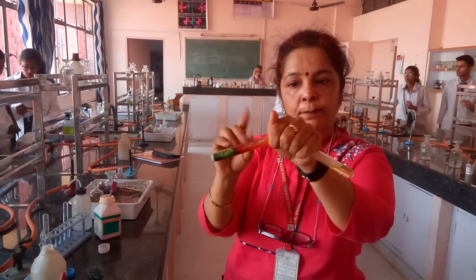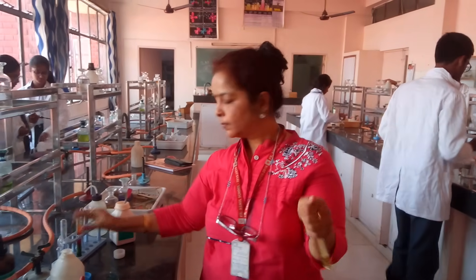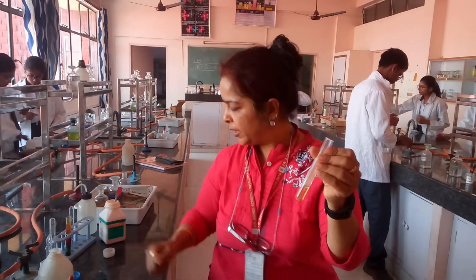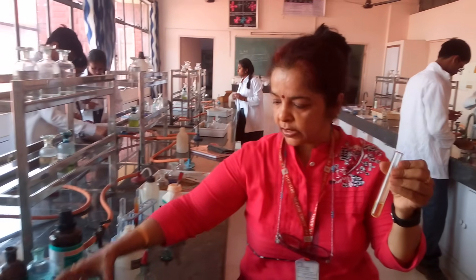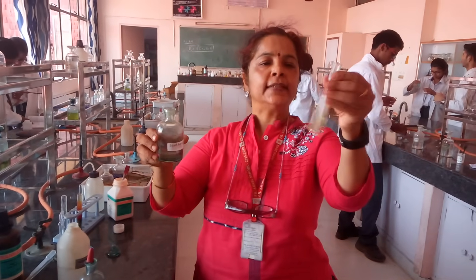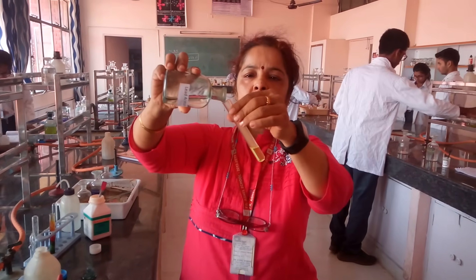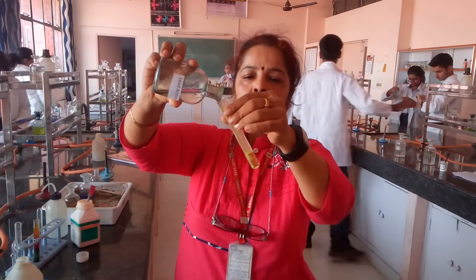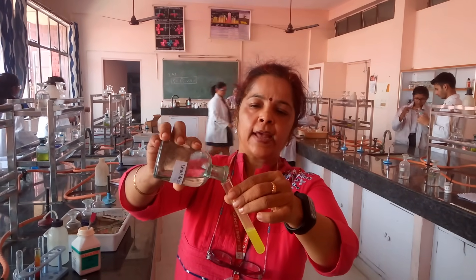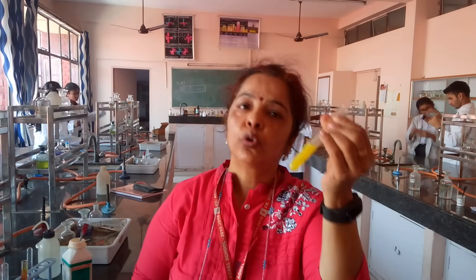This is just the first step: generation of chromyl chloride gas and passing it through NaOH to make sodium chromate. Now you need to add lead acetate solution to the sodium chromate formed and observe what happens. You get a yellow precipitate formed on adding lead acetate, and this yellow precipitate is of lead chromate.